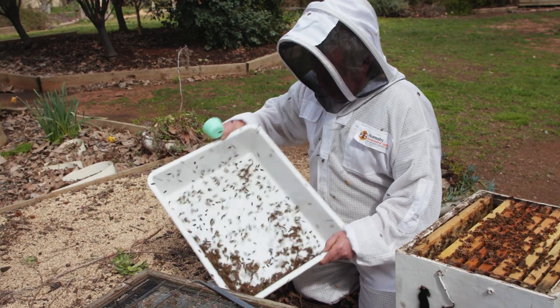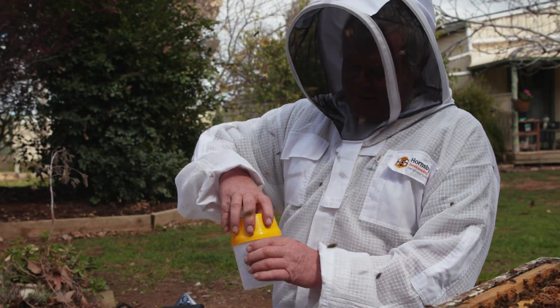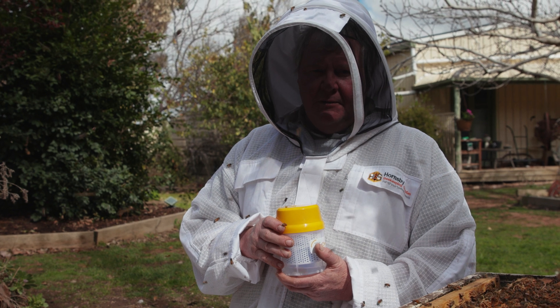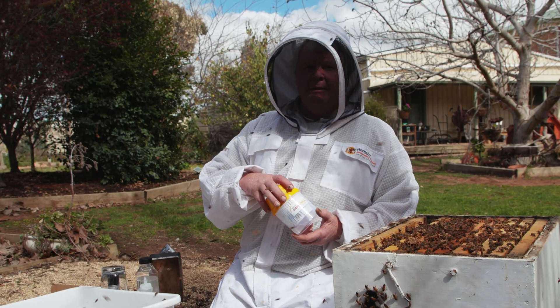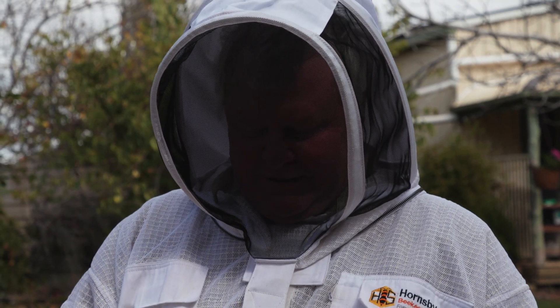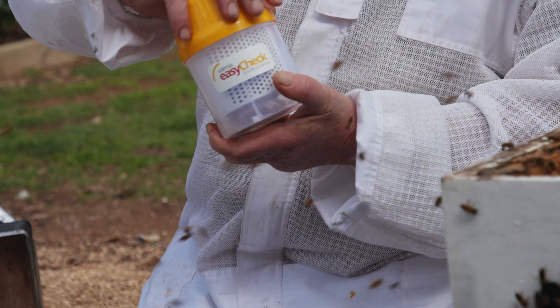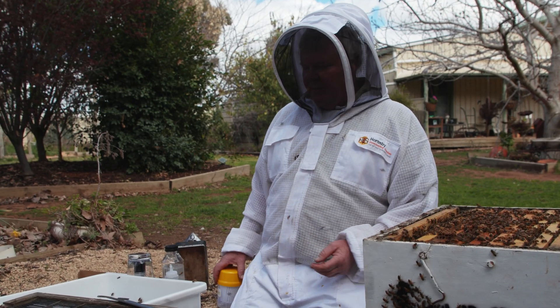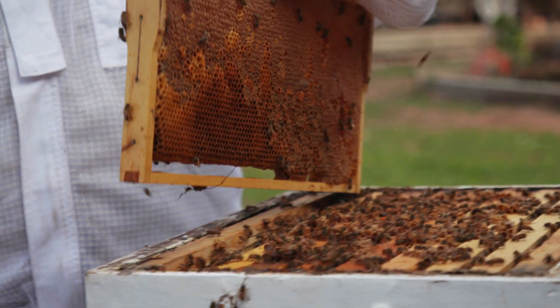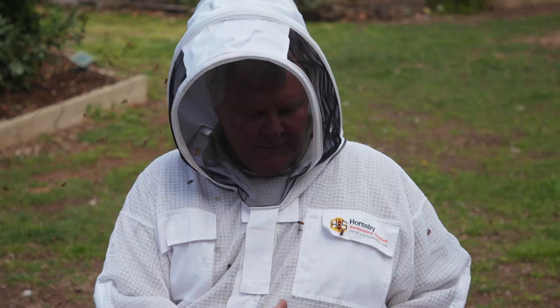So now we're gonna shake our girls into a bit of a pile, get our cup, make it about 300 bees, keep our bees in our tester box, and put our lid on. I'm not really happy about this, but what do you do? You got all the trouble looking after these girls and you gotta do this to them. This is crazy. Everybody's sad. It's not really sealed very well — trust me, they're dead. I'll just let that sit there for a little bit while I put the hive back together. How do you have that conversation with your bees and say that we are actually trying to look after you? This is just a necessary evil that's become.